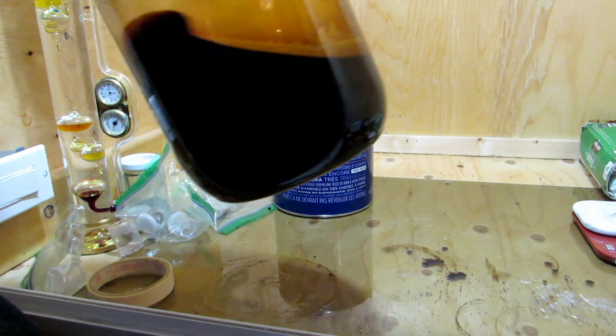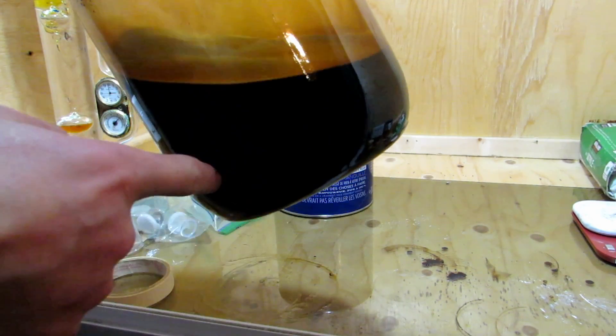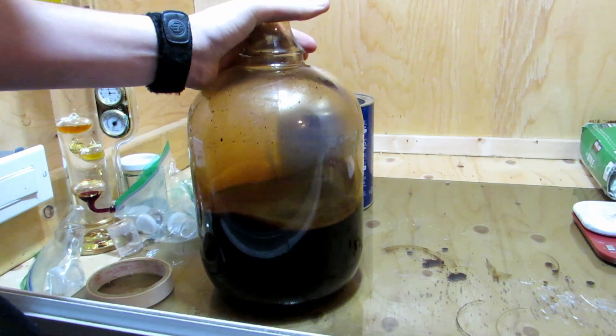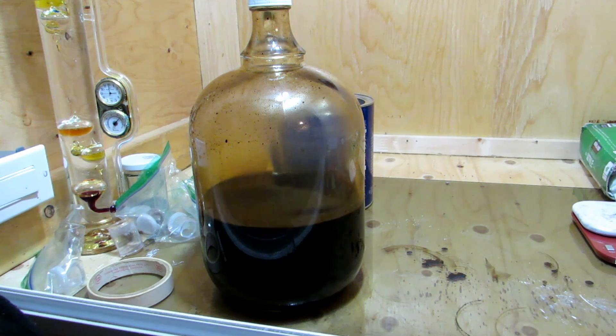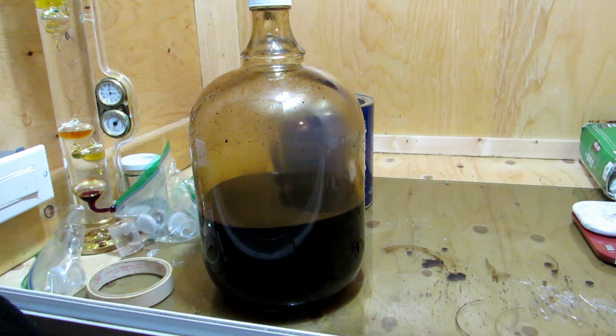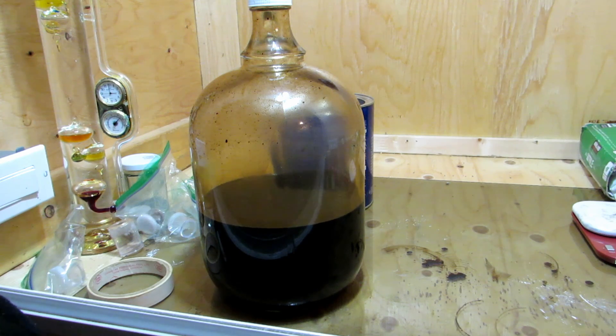We now need to wait a fair amount to let it settle out to the bottom. The organic layer is about right here where the dichloromethane is. The dichloromethane seems to have picked up some sort of organic material because it is now an orangish-brown color. The reason why we didn't put it through coffee filters was because it would take a long time, the solution would cool down, and some of our caffeine could possibly come out of solution and crystallize out.